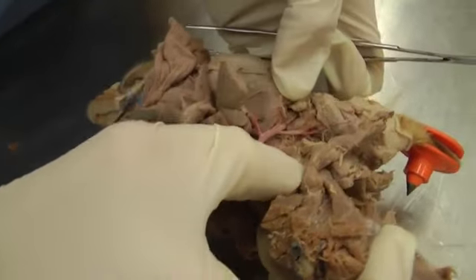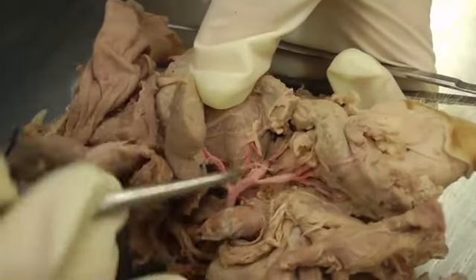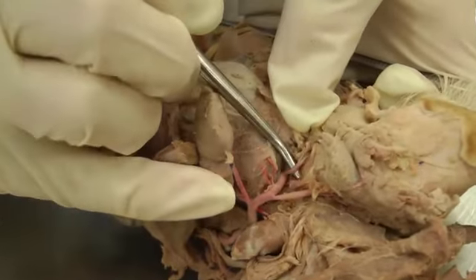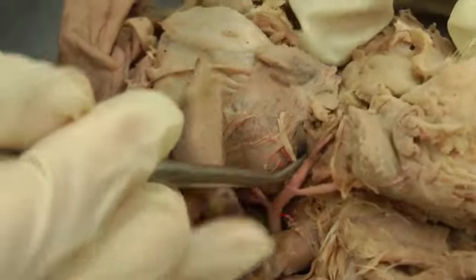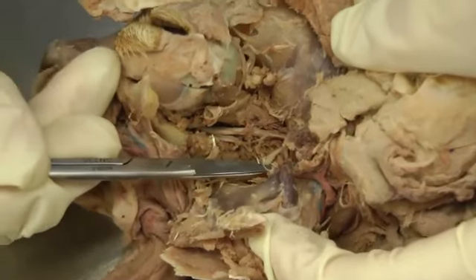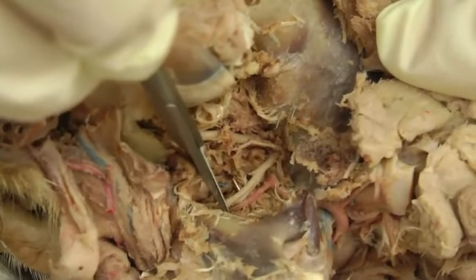And you can just kind of move things out of the way as needed to do this. And so here we have that caudal auricular artery here. And then we have the superficial temporal. And this cat is pretty small, so it's right here, superficial temporal artery. And then this becomes maxillary. So then our maxillary artery we're looking at in this deep dissection field here. So maxillary is coming through, then maxillary here, and then inferior alveolar artery following along with that same nerve of the same name, going through the mandibular foramen there.